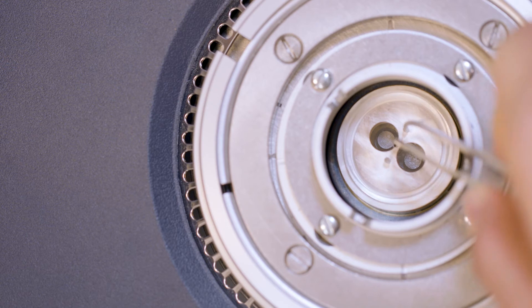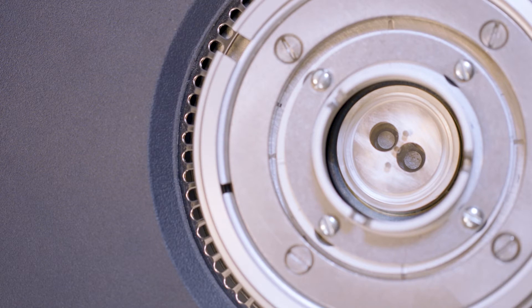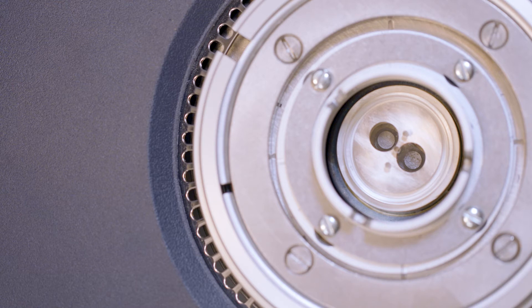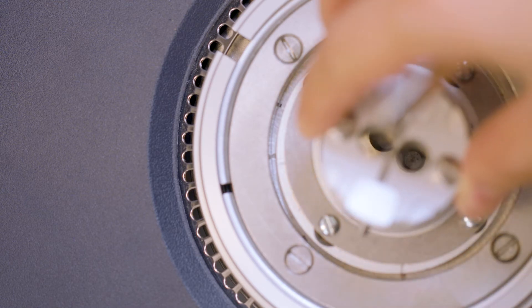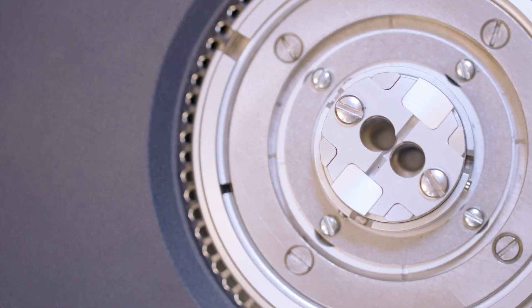Use tweezers to place the quartz window over the silver lid. Make sure that the holes are not positioned over the sample reference platform so they do not interfere with the light coming into the cell during the PCA experiment. Make sure the vertical positioning screws in the light guide adapter are set to the lowest point.